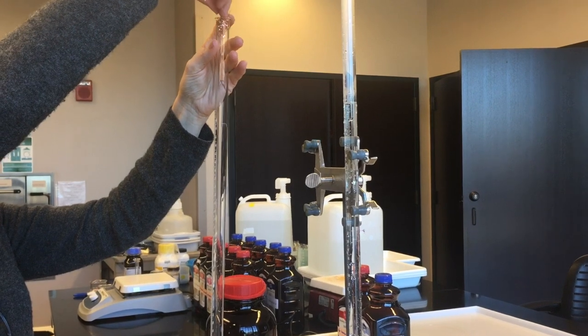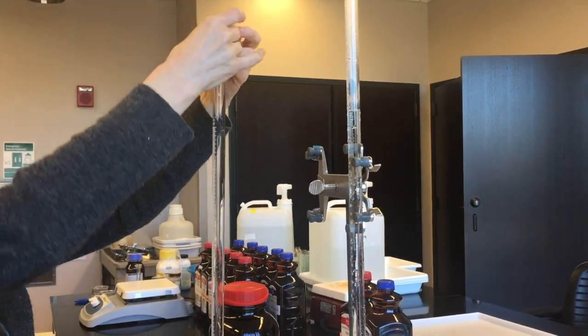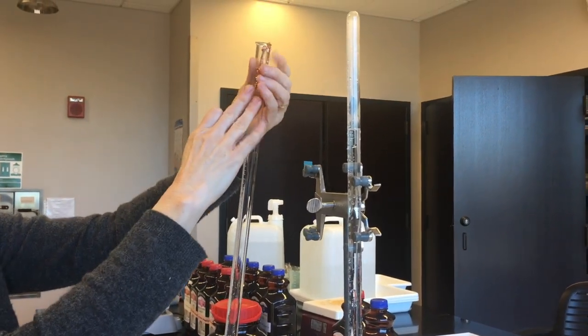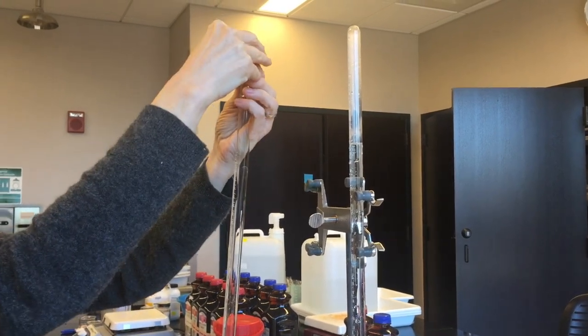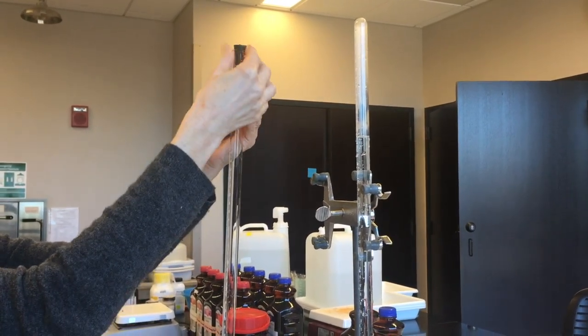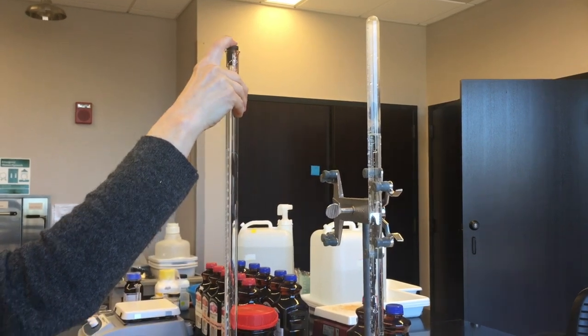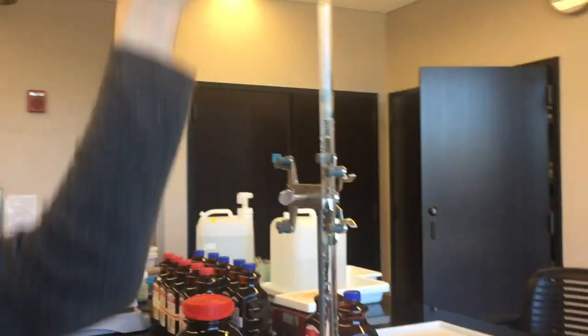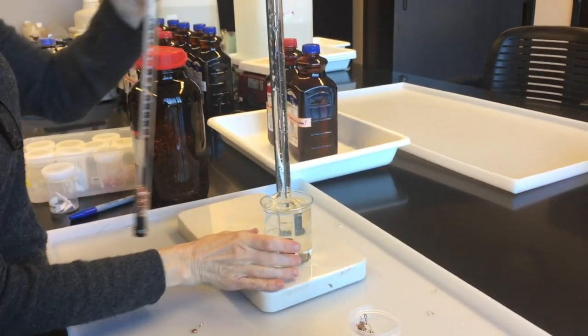And then you're going to fit in your copper bundle with a tail sticking out. That's the whole point of having the tail is so that it's sticking out, so that later you'll be able to pull it out. And at that point you flip it upside down and you put it into your water bath.